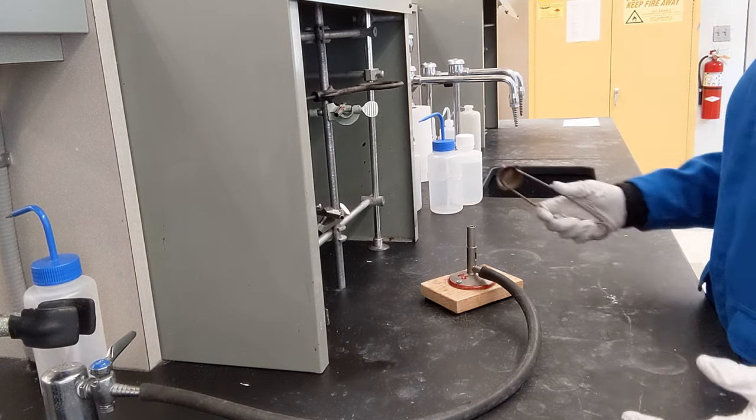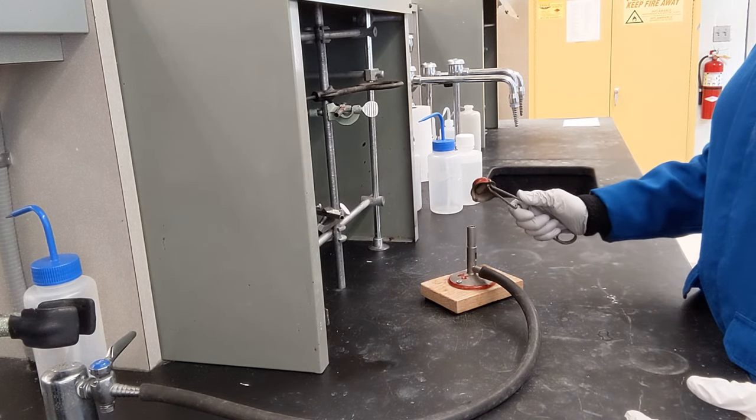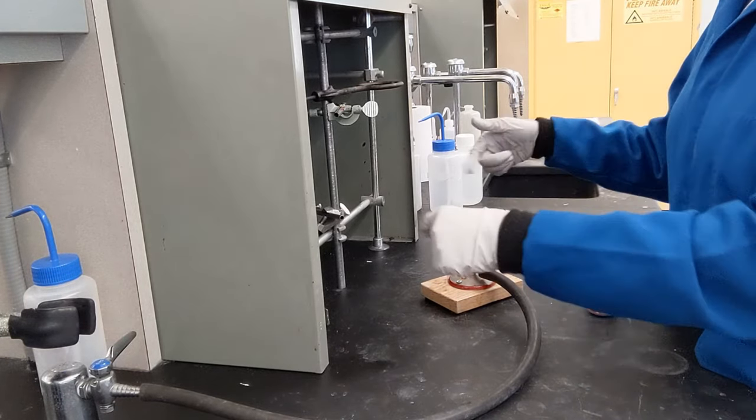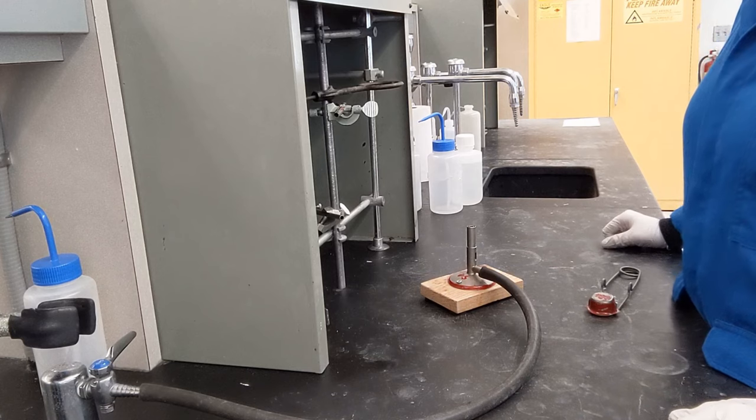So if it's taking you more than a couple of attempts to light this, you need to turn the gas off. You need to give your fume hood time to suck away the gas.